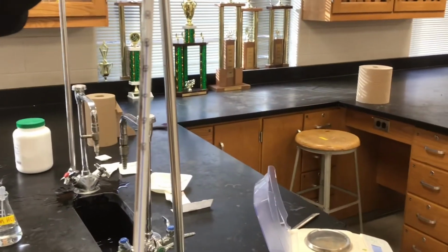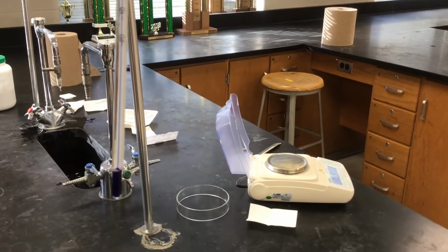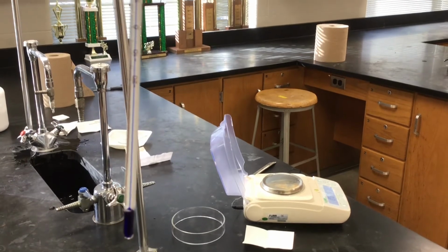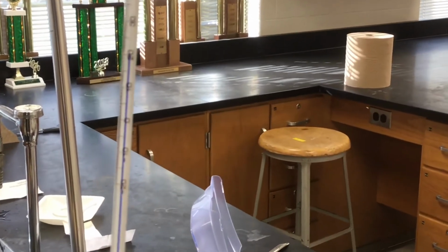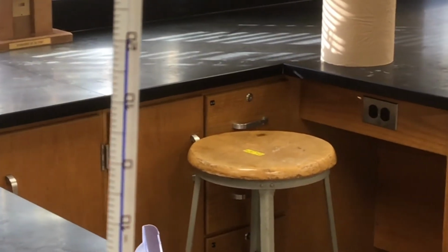I will point out it's Mr. Moore's favorite thermometer because it has blue spirit in it. It is. All of our other thermometers are red. We used to have a dozen of these, but over the years, all of our blue ones, except one, have broken. Yes, this is precious. I really do want to cry when they break those blue thermometers on me.